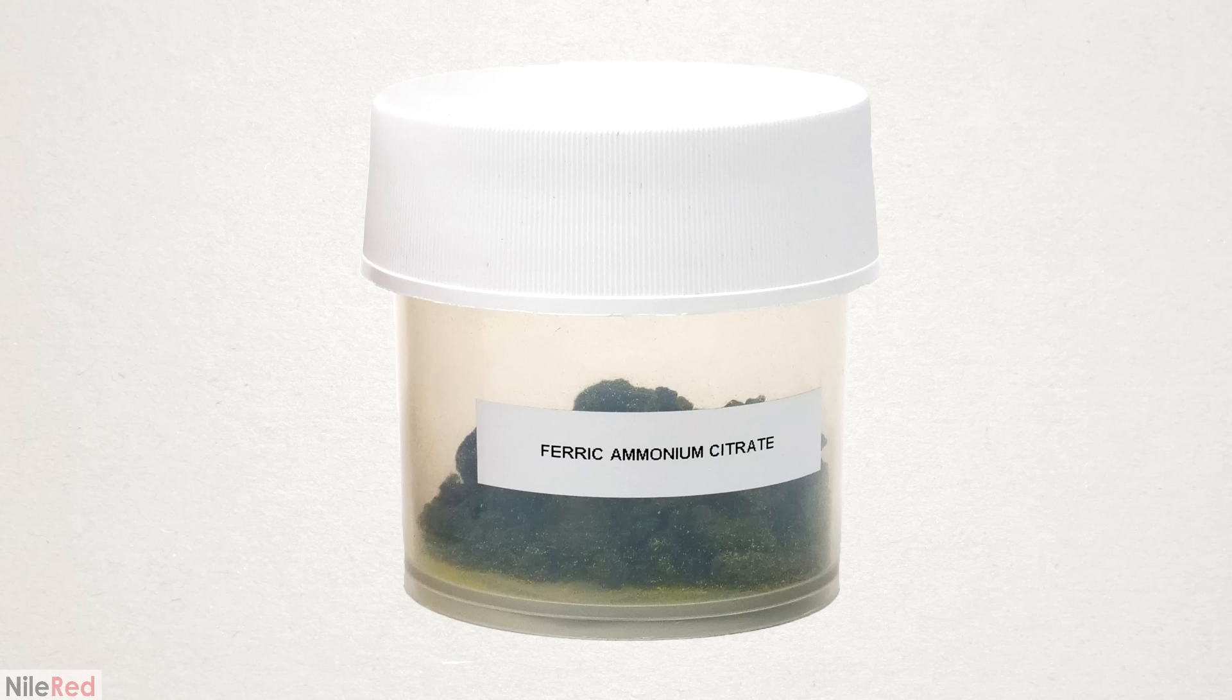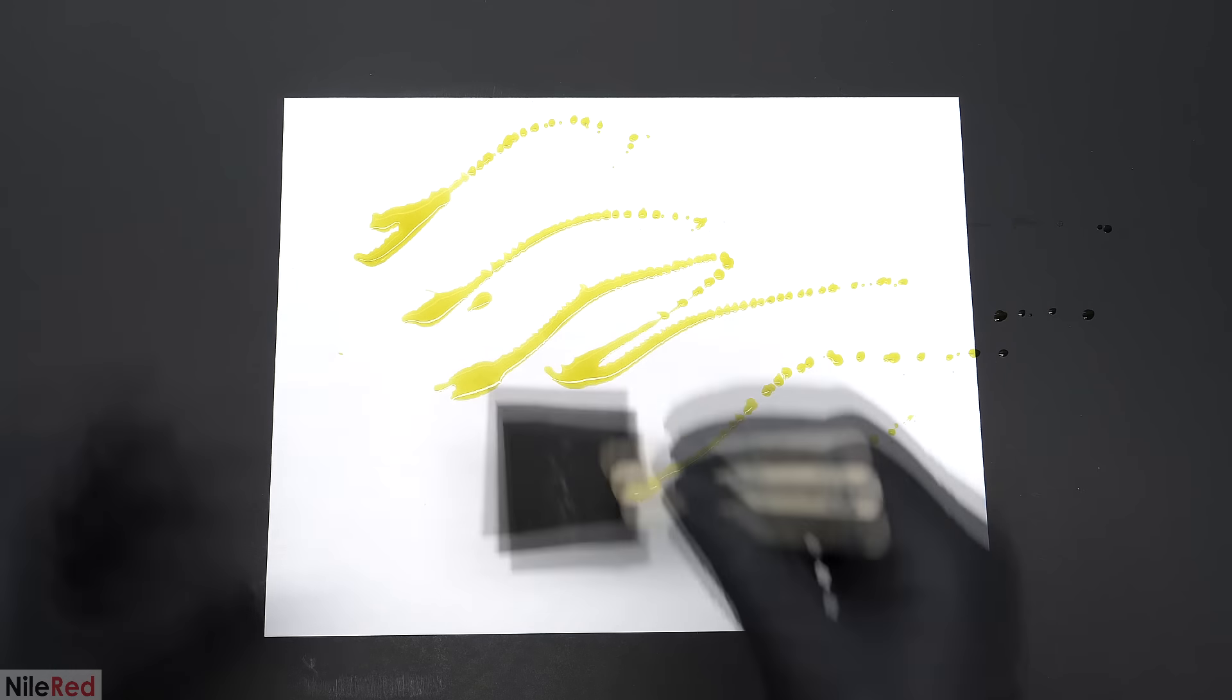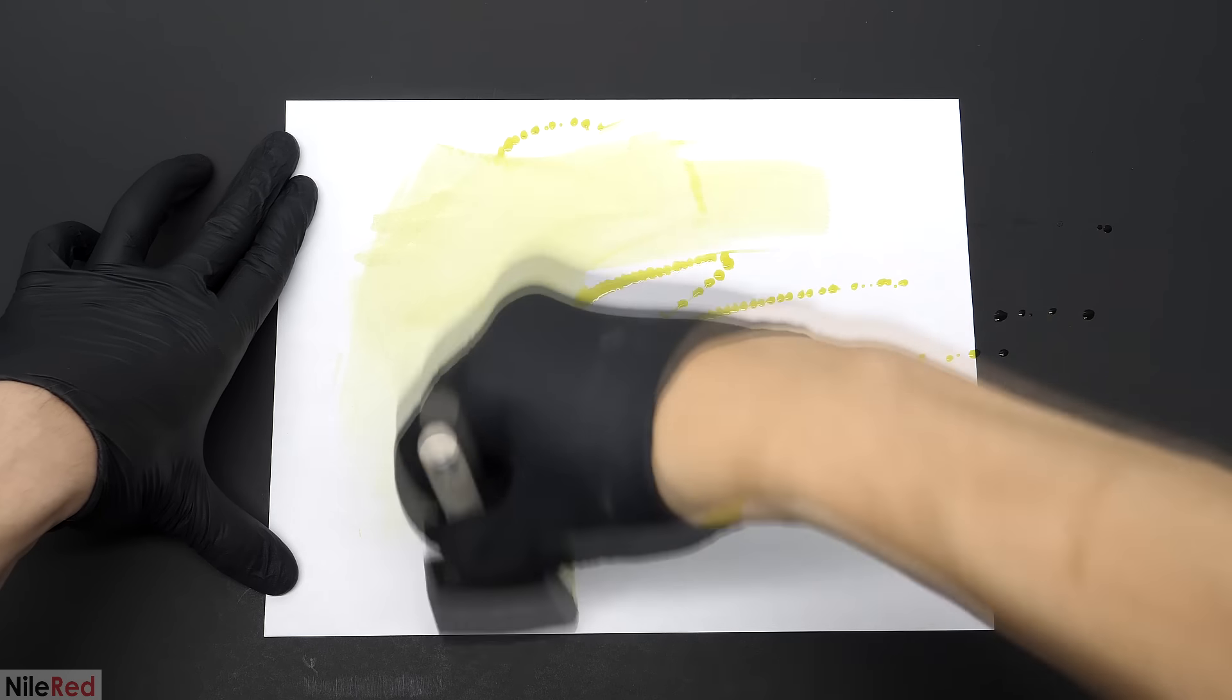Anyway, the goal of this video was to make this new iron compound and to test it out by trying to make my own blueprint. I'll also talk about the chemistry behind the whole process, which I think is really cool.